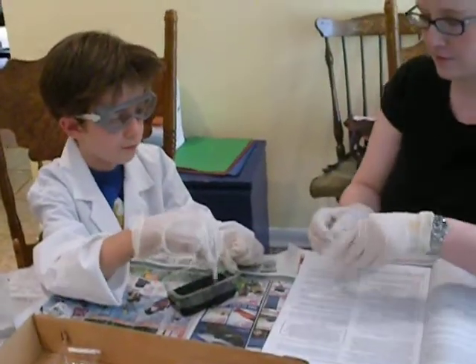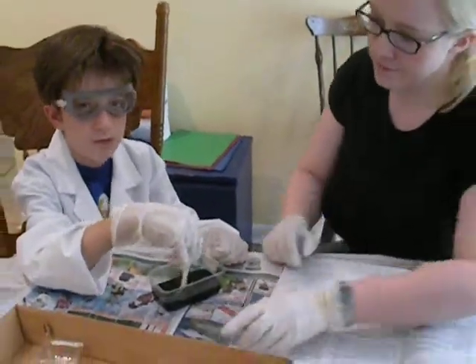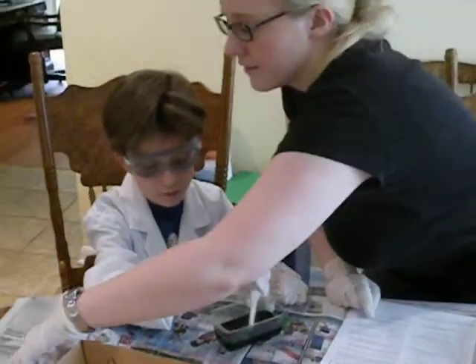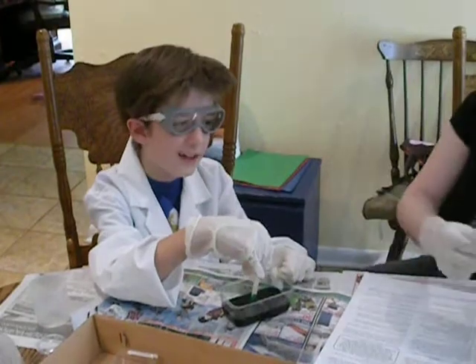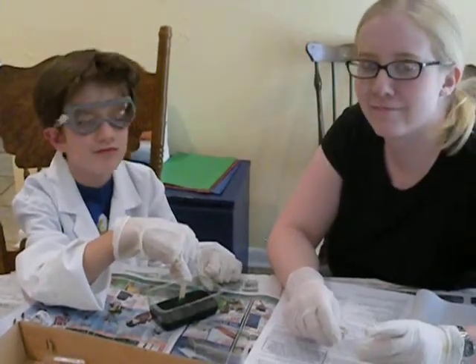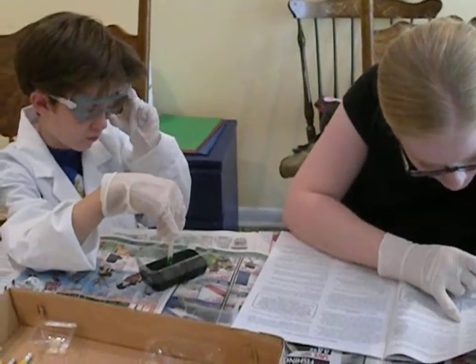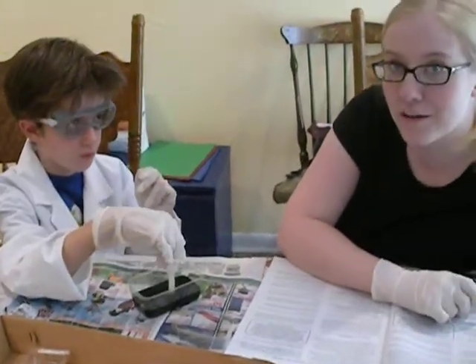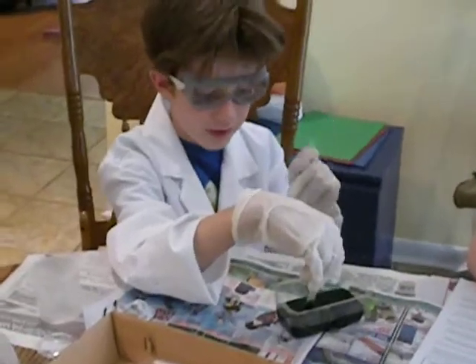Keep stirring. I was thinking anything interesting is going to happen for a little while. We're just going to, let's see, after this... I don't think anything interesting is going to happen. Okay, we'll check back in later, professor.